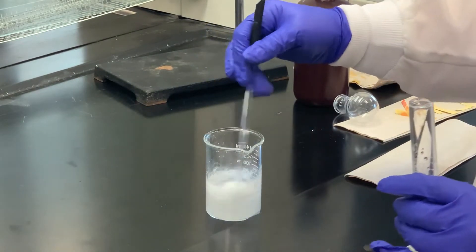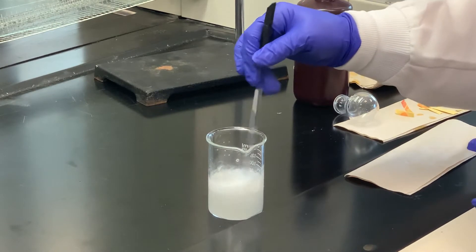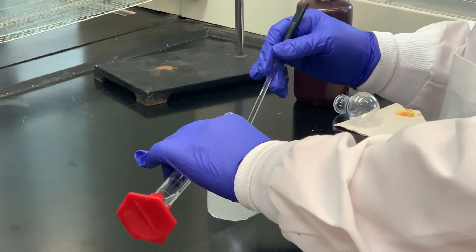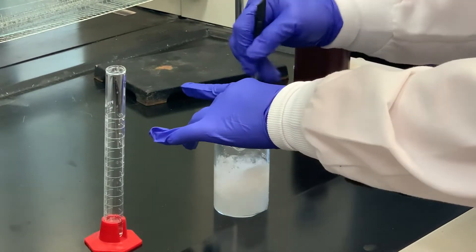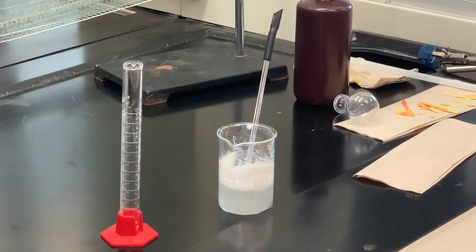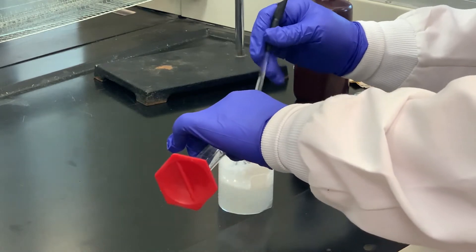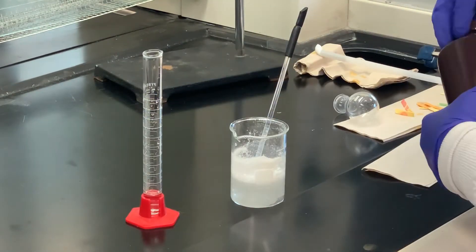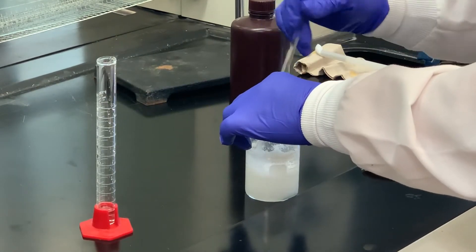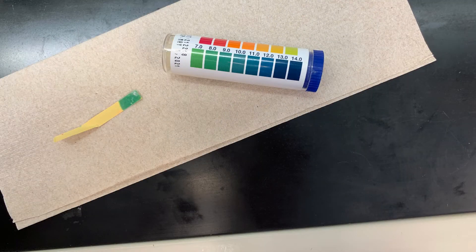You can start to see some of the benzocaine has started to precipitate out. We're at about a pH of 6, so I don't think it'll take much more. And that looks close to 8, so I think we've added enough of the base.